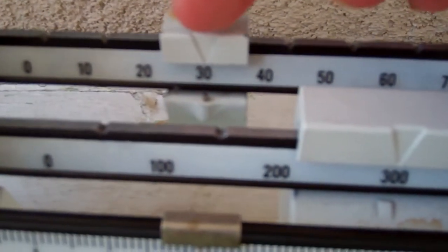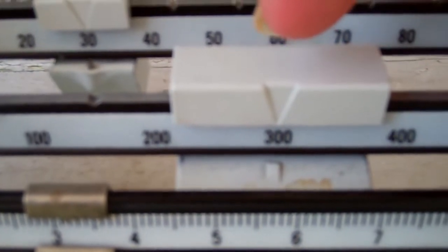This is easy. It's on thirty. This is easy. Sitting on three hundred. So far we're at three hundred and thirty.